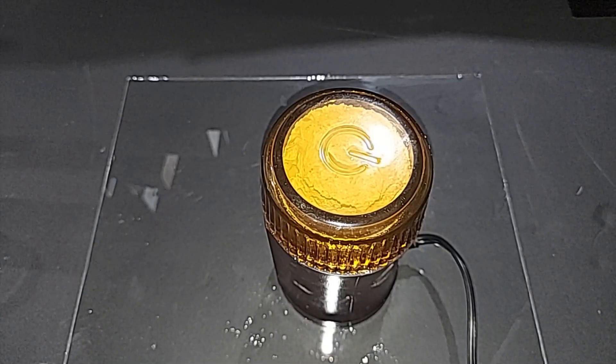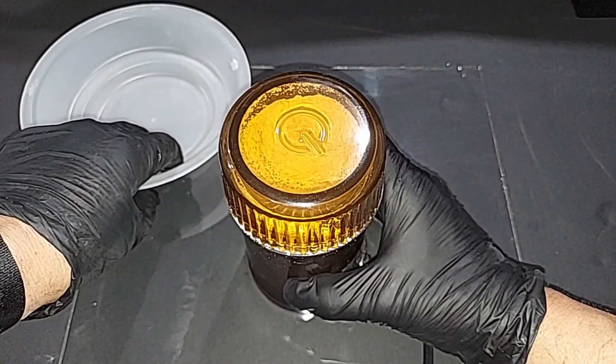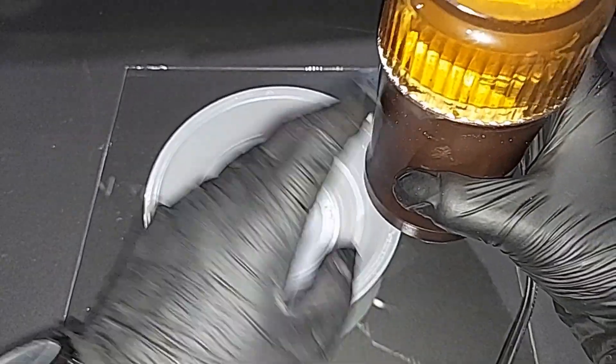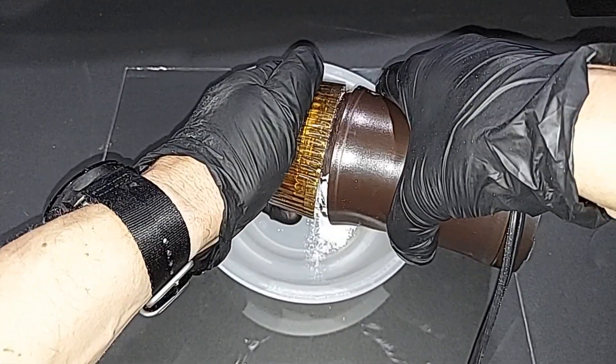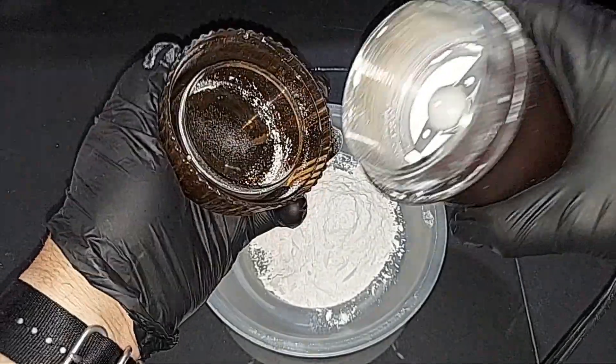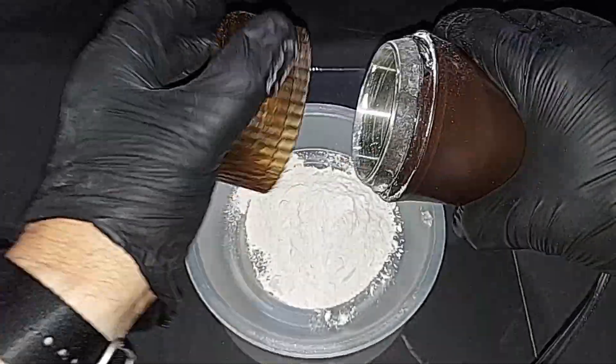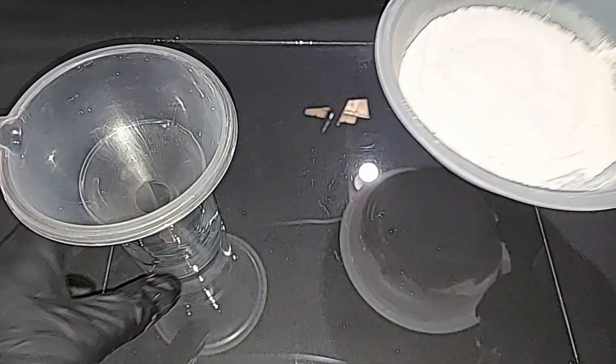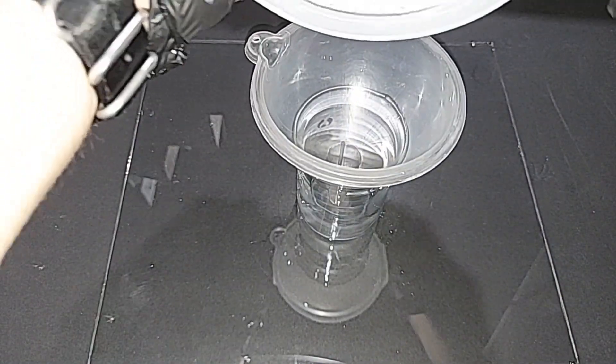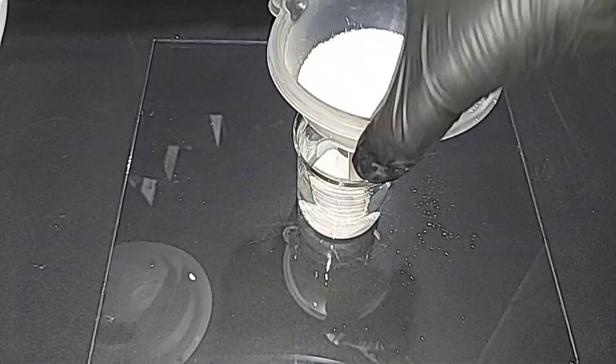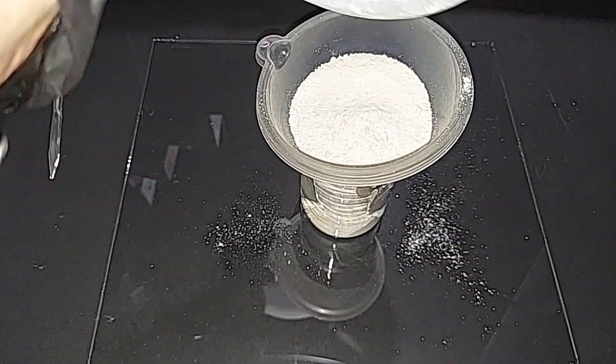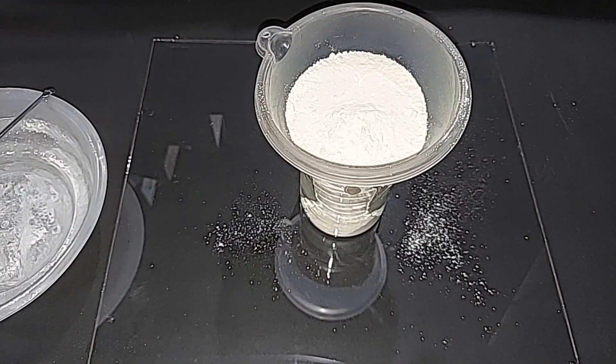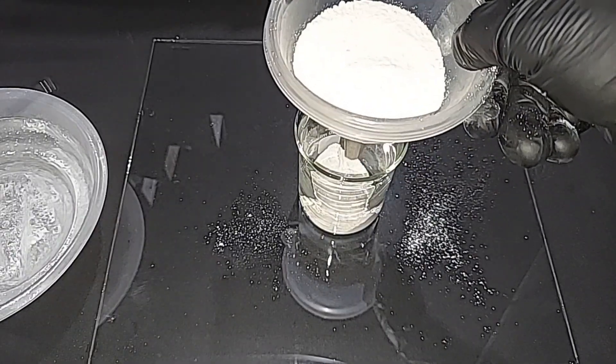I'm going to wait for it to settle for a bit before we turn the thing upside down. It's been about 15 minutes here. So, oh gosh, that did get warm, but I think it worked well. Nice. I'm going to now transfer the mix into a beaker that I will be using to heat it in. Well, we're losing a little bit here and there, but I'm sure that's in micrograms, so it's not a big deal. Plus the mix is what's most important.